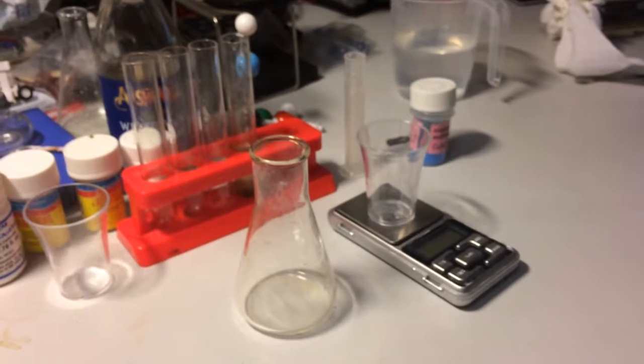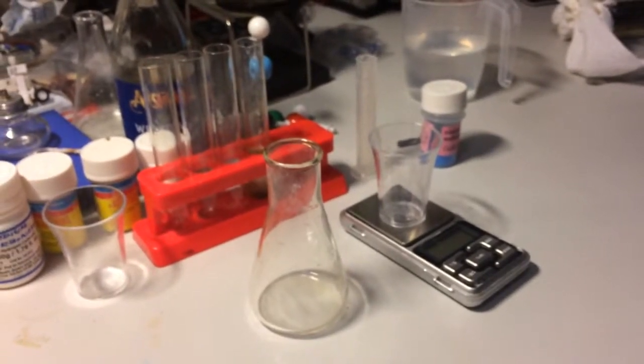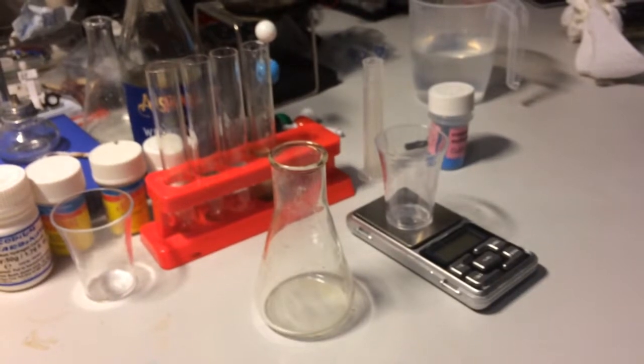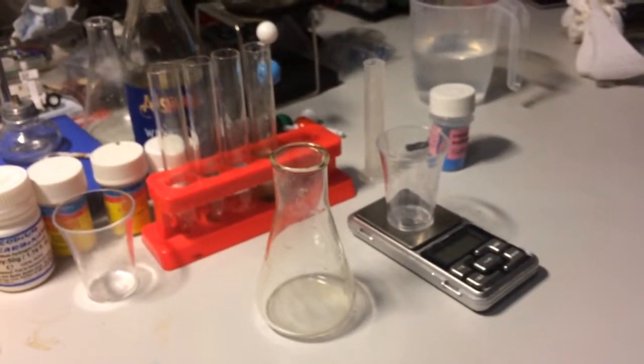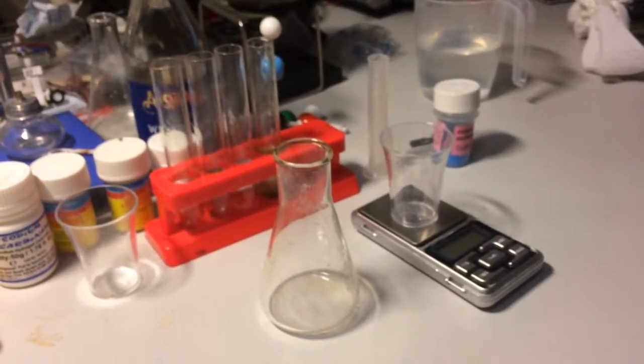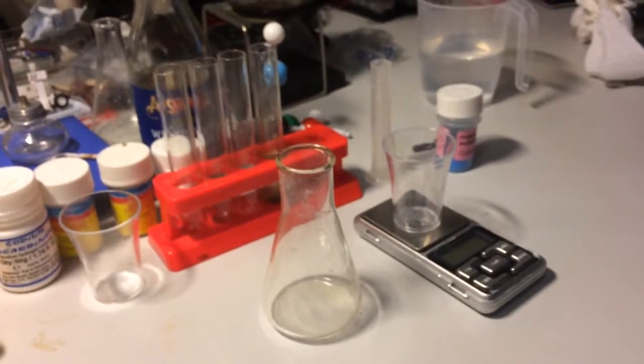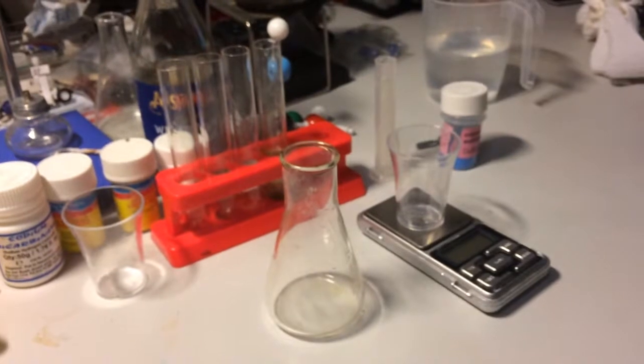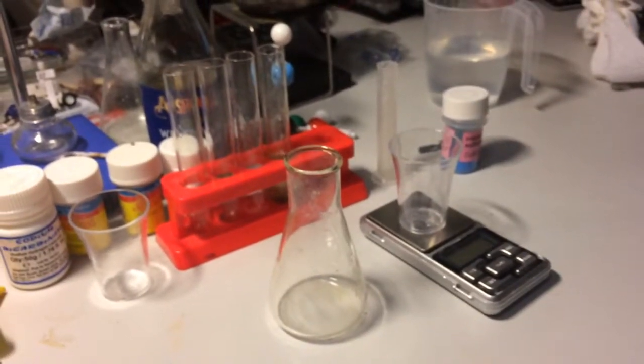Hello. In today's experiment, we'll be turning one metal into another metal, just like an alchemist. Except today, instead of turning a metal into gold, we'll be turning a metal into copper. More specifically, iron into copper.